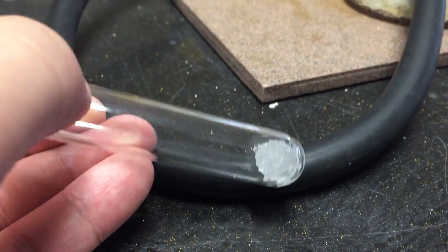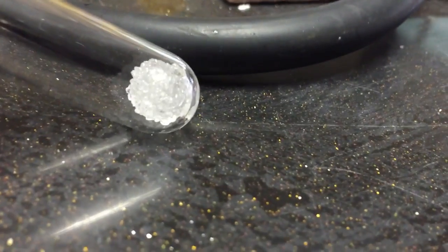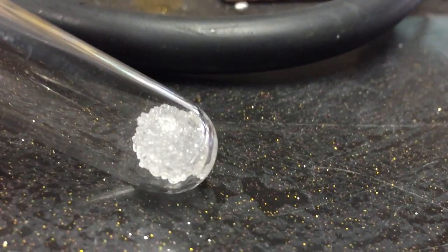Pure calcium nitrate crystals are shiny and crystalline in appearance. What you're looking at right now is a sample of hydrated calcium nitrate where the crystals still have water in them.